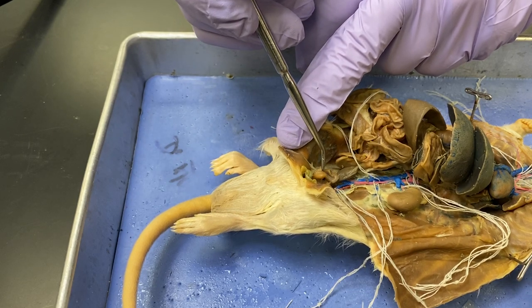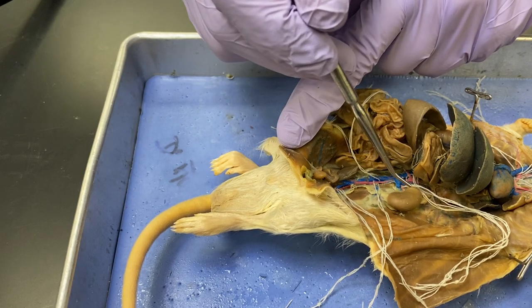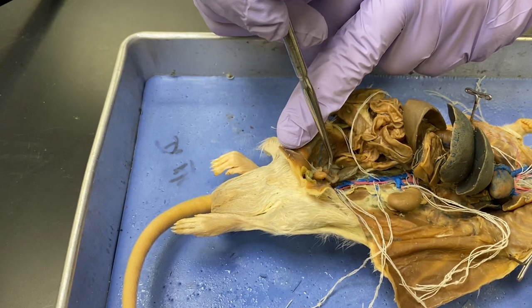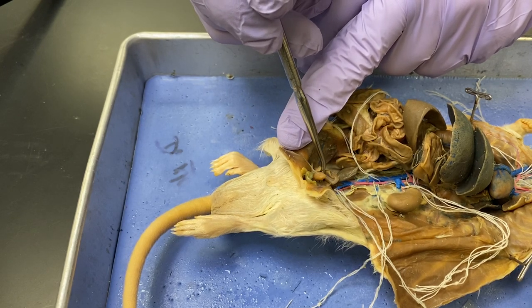That little thing — that's the bladder. So you really lose track of the ureter behind the seminal vesicles, but they re-enter the bladder from behind.